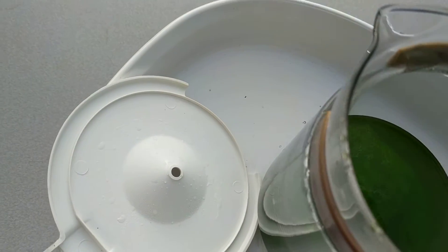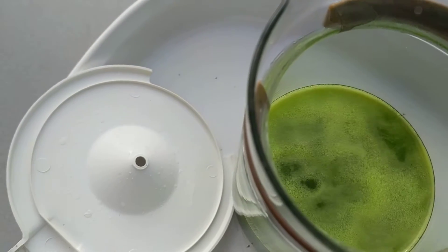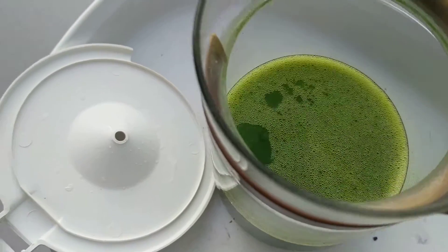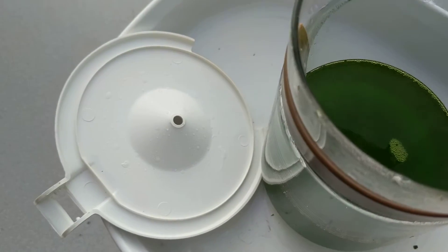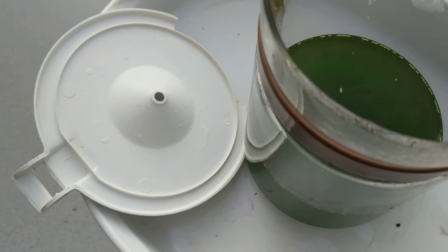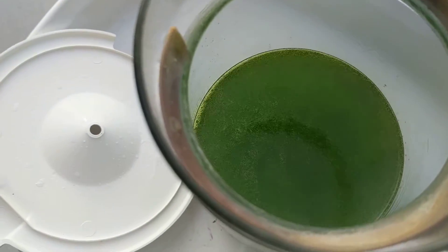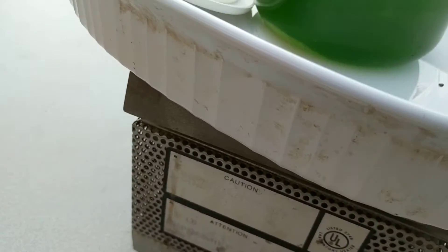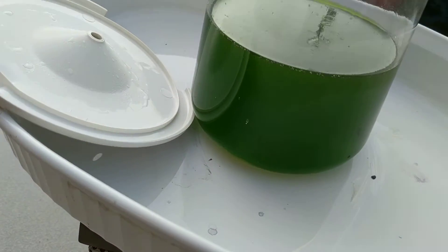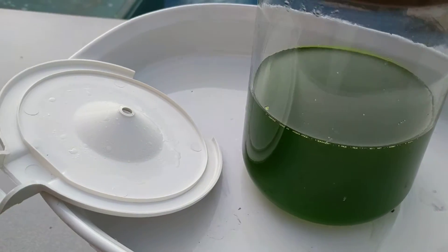We want to kill the nitric. I don't want to get my phone too close — this thing has been through enough as it is, if you guys saw it you'd laugh. Just start putting more in here. Yeah, that's what I thought — see that at the bottom? I don't know how much more that'll take care of.